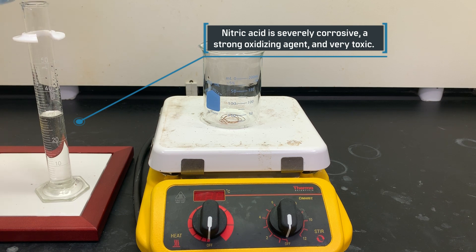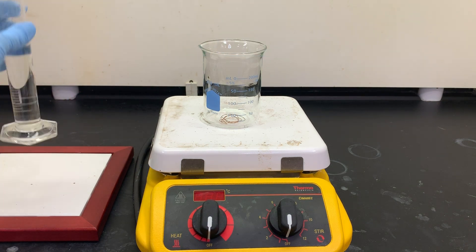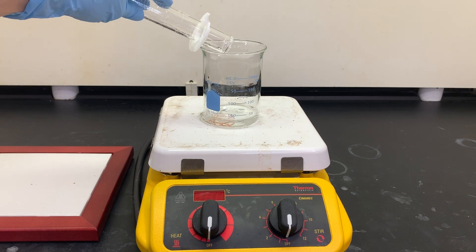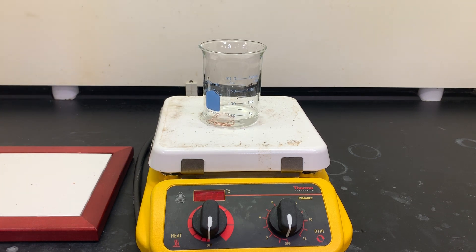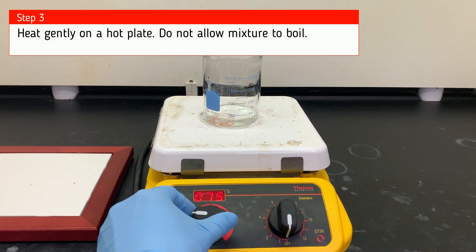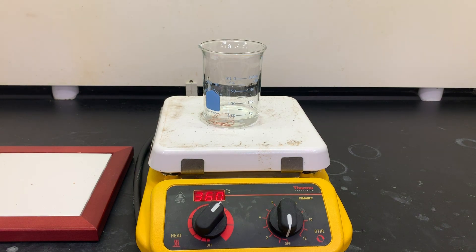Before we start this reaction, be sure that you record observations of both reactants. Now we're going to heat this reaction mixture very gently on a hot plate. We want to be careful not to allow the mixture to boil.